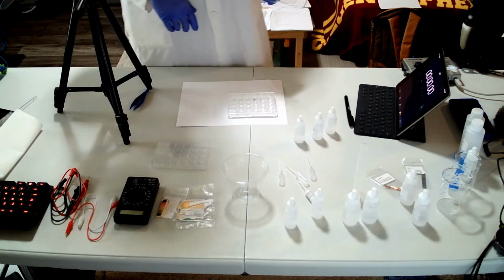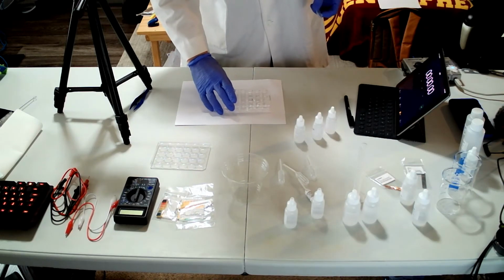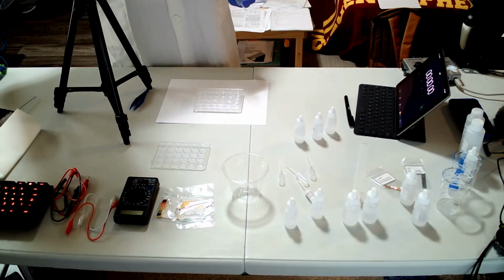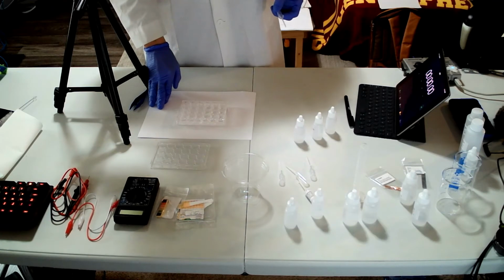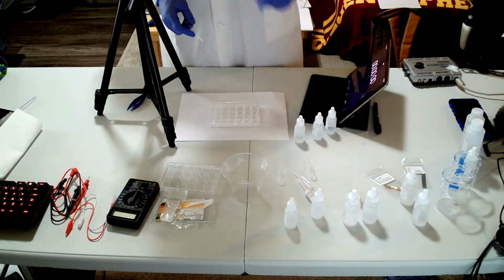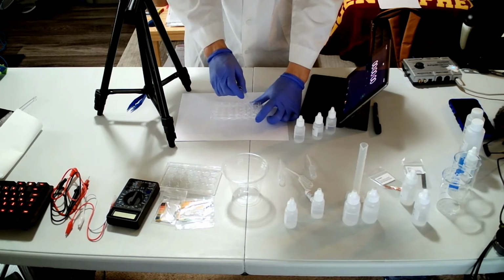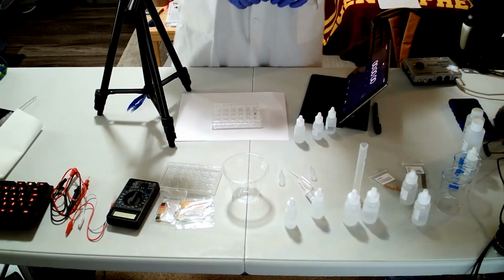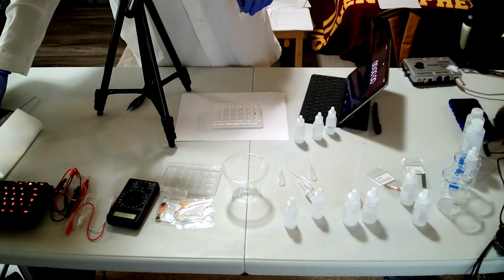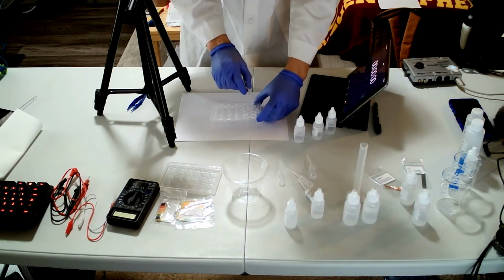So you set the well plate back on the paper, C1 over X, like this. I will need a timer, and this one. The next step is to zero the timer, one hand, ready to begin. That is procedure number 11. So from here to here, and then push it down.